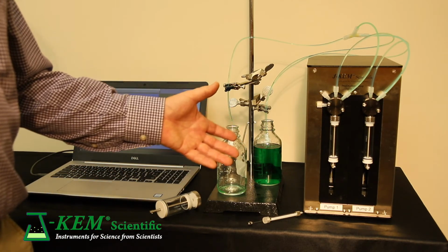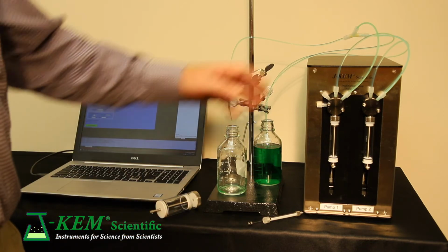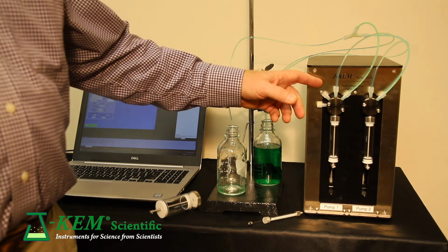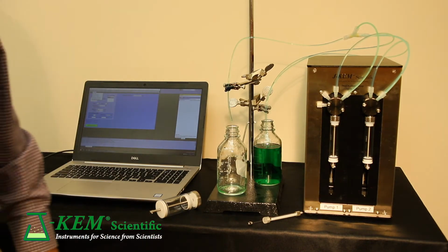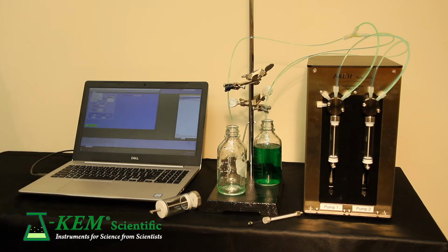You can get the pump in many different configurations. What's in front of you now is a dual position pump because it has two independent syringe pumps on it. You can buy a single position pump, which would have only one module on it. As I said, this is a dual position pump, but it's routine that we sell 4, 8, 16, or even a 32 position system. So you really can customize it to anything that your application needs.